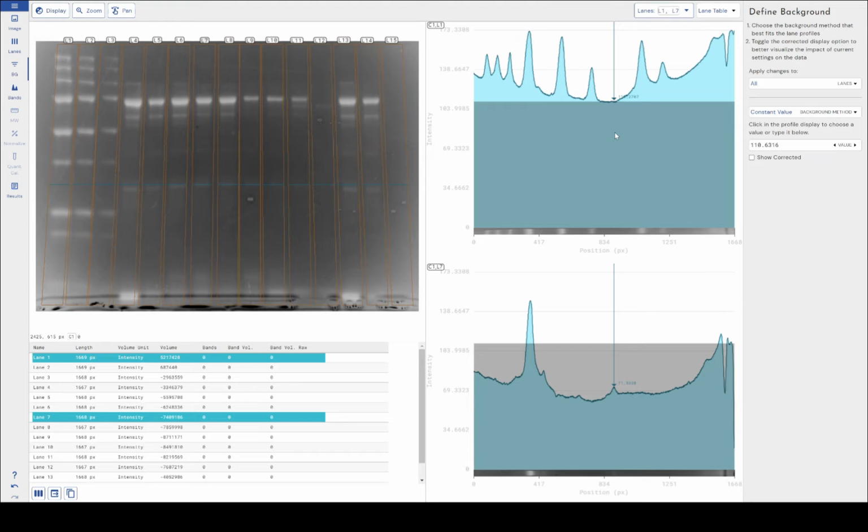It's very rarely the case in any image, to be honest, but certainly in this image, we know for sure that there is not an even background value that's going to spread evenly across this image. So you can see here, as I've selected this value, that's a fine background subtraction value for this lane, but if I apply it to this lane, it's going to cut off huge amounts of my data and make this band, when quantified, much smaller than it actually is in its true value.